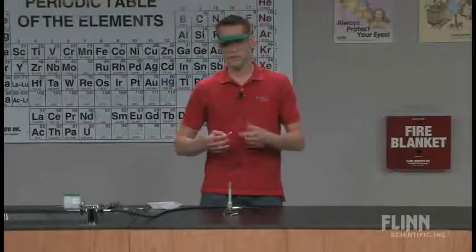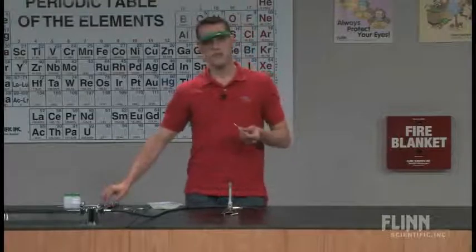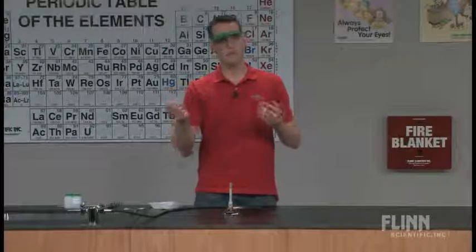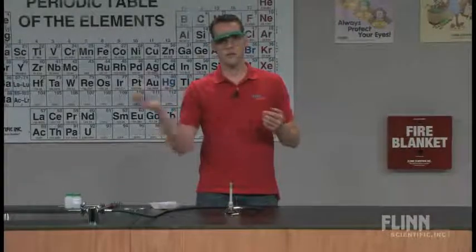So the first thing, my students already see this. I'll show you the flame test procedure for potassium and for sodium. I also found that when I did this, I told my students Q-tips have two ends, use both ends. They don't. They use one, they throw it away.